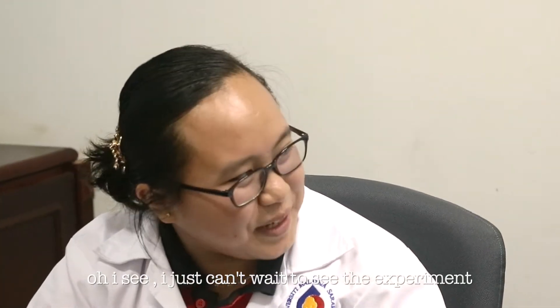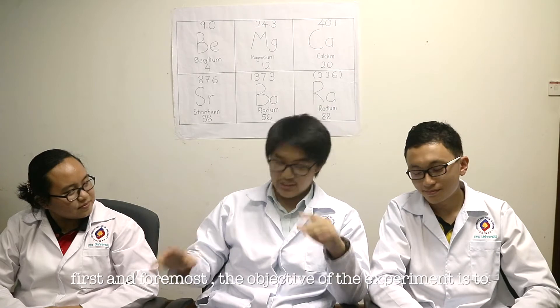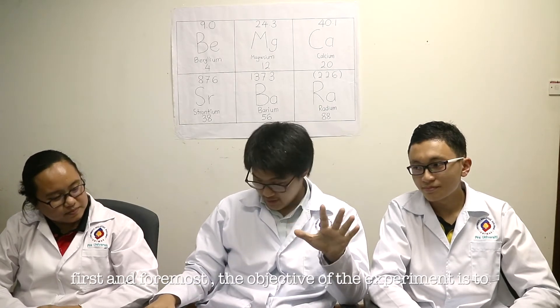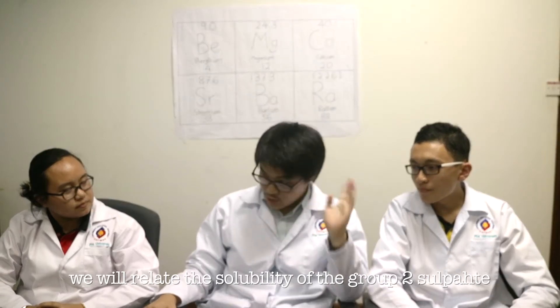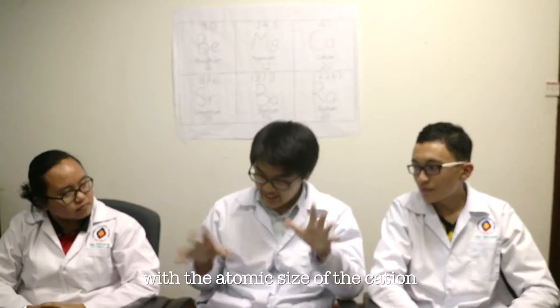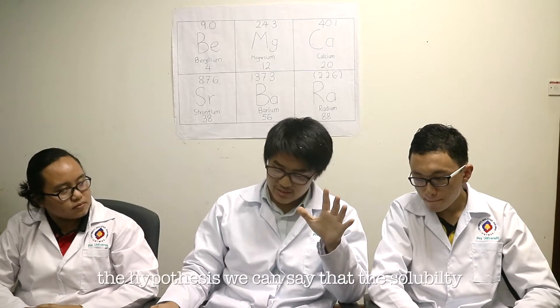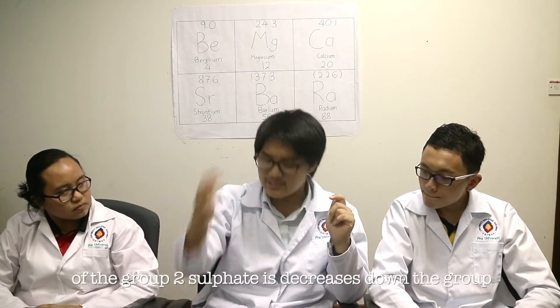I can't wait to see the experiment — shall we start, Professor? Alright, we shall start now. The objective of this experiment is to observe the solubility pattern of group 2 sulfates. The second objective is to relate the solubility of group 2 sulfate with the atomic size of the cation. Our hypothesis is that the solubility of group 2 sulfate decreases down the group.